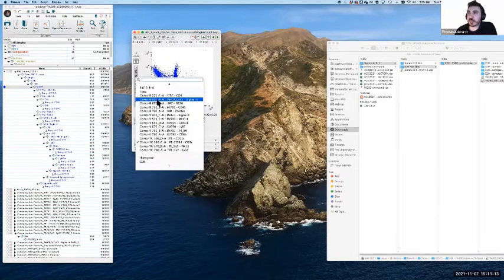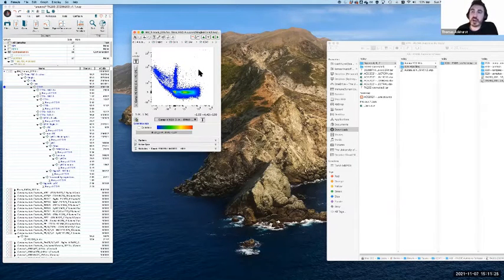So, in this particular panel, we've got a couple of options, but obviously the main ones are CD4 and CD8. It's possible that it's actually CD4 or CD8 that's the culprit, because we know that they are both highly expressed on CD3 expressing T cells. So if we take a look at CD4 first, no, that's not really it. We're seeing the super negative, but it's not that kind of mathematical lean that we're trying to find. The other obvious option here is CD8. And sure enough, that is the one. That's the curve that we're looking for, that tells us that there's overcompensation going on.